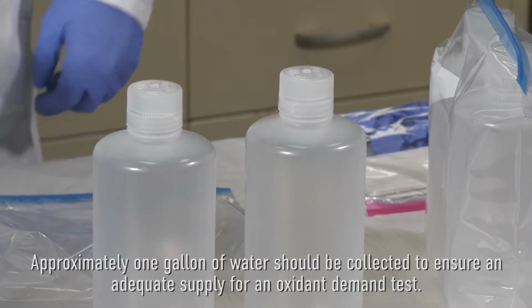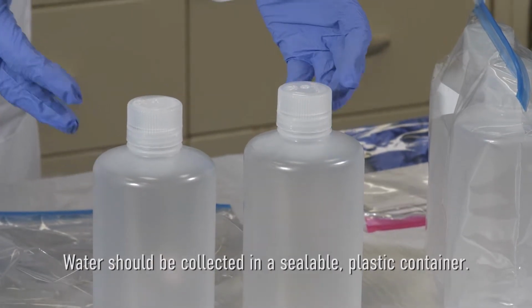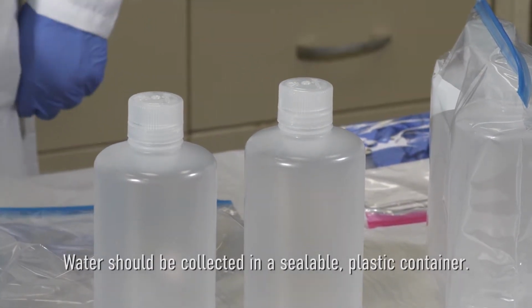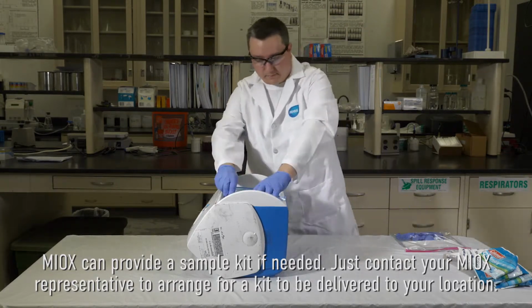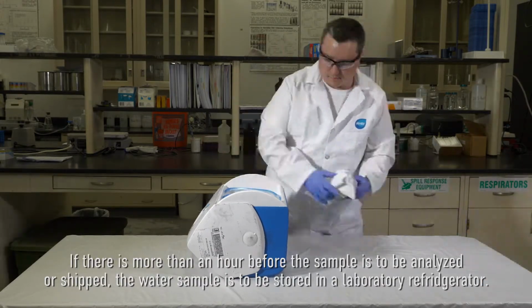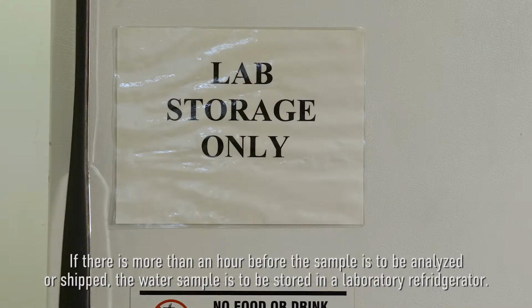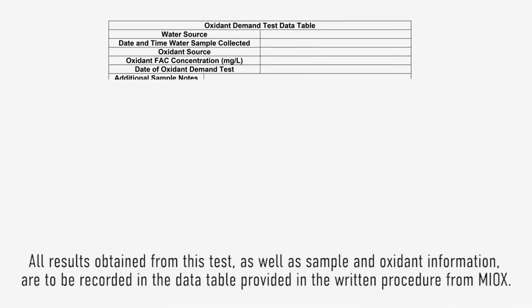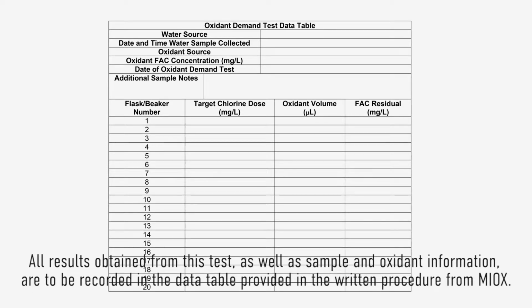Approximately 1 gallon of water should be collected to ensure an adequate supply for an oxidant demand test. Water should be collected in a sealable plastic container. MIOX can provide a sample kit if needed. Just contact your MIOX representative to arrange for a kit to be delivered to your location. If there's more than an hour before the sample is to be analyzed or shipped, the water sample should be stored in a laboratory refrigerator. All results obtained from this test, as well as sample and oxidant information, are to be recorded in the data table provided by the written procedure for MIOX.